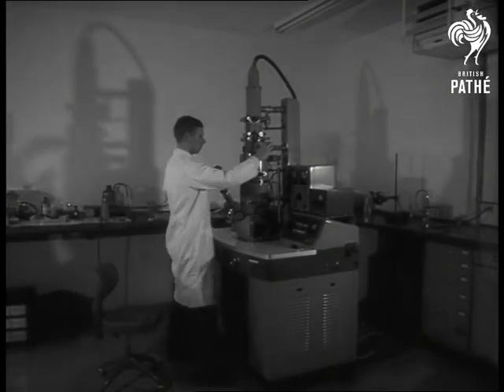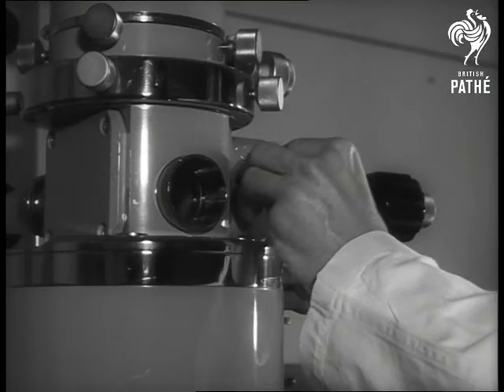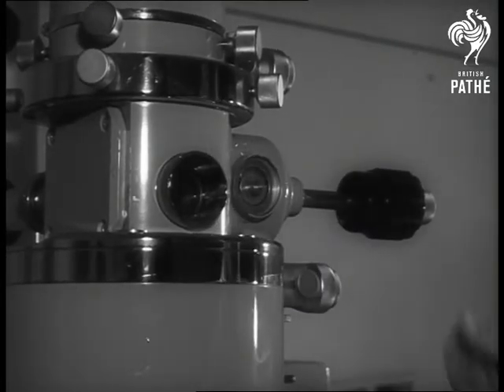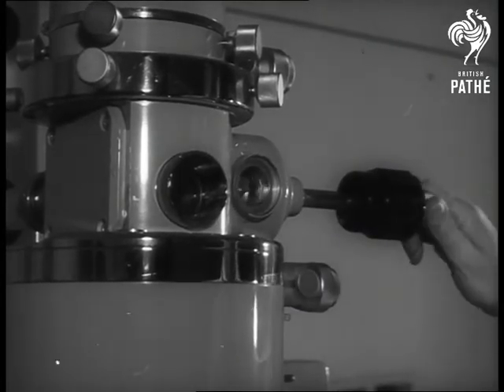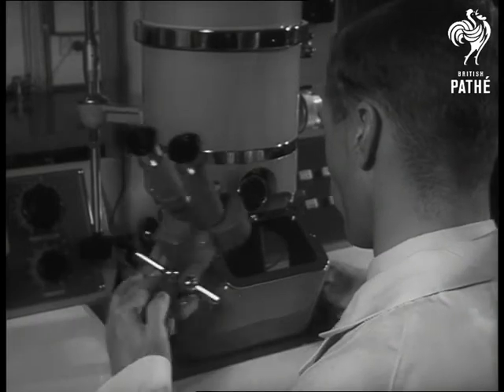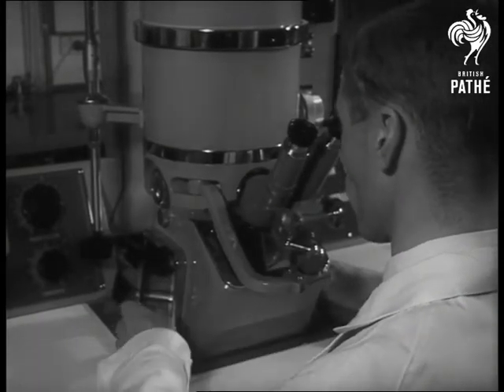The basic elements of the electronic microscope follow those of the optical type. But there is a difference in the form of illumination, and the magnification is many times that of the optical type.